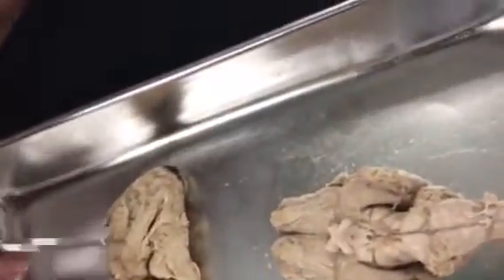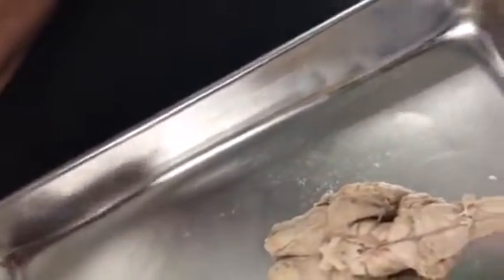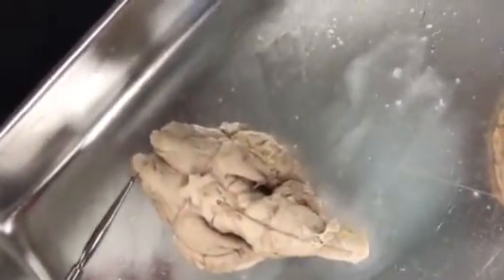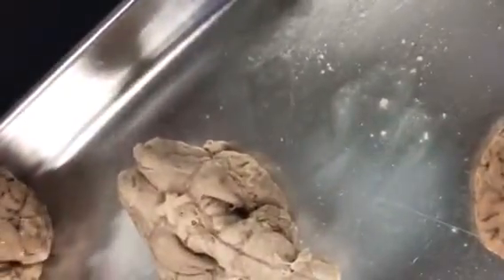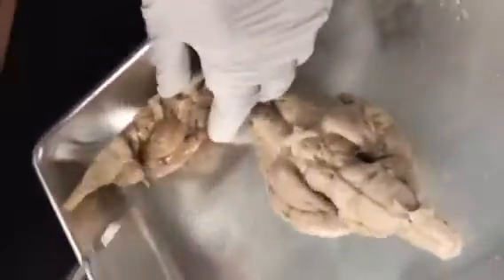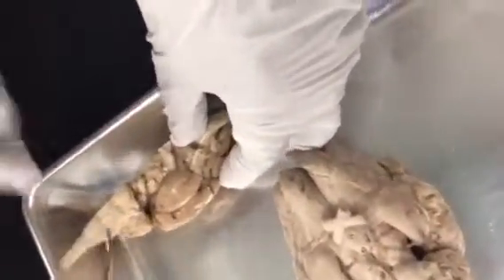Now, could you go over these ones here, the olfactory, those ones? Okay. So, this is ugly. Anyway, we have these things sticking up here, which you can see a little better on some of these. I don't have gloves on. You guys have gloves. You're just standing there watching. Yeah, hold it there for me. Hold it by here, though, because I have to demonstrate.